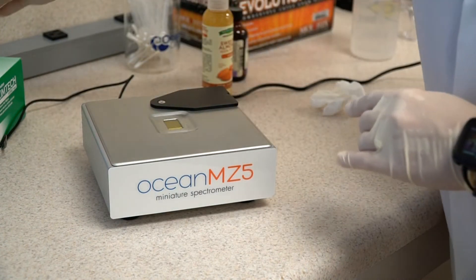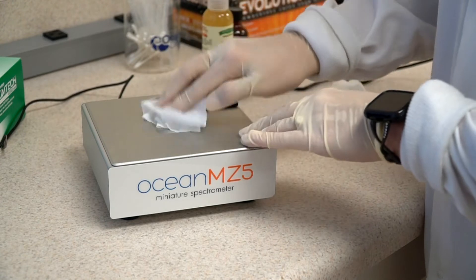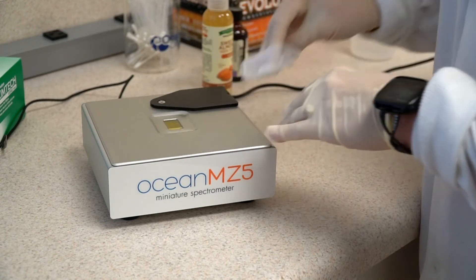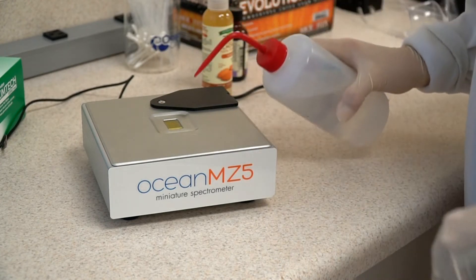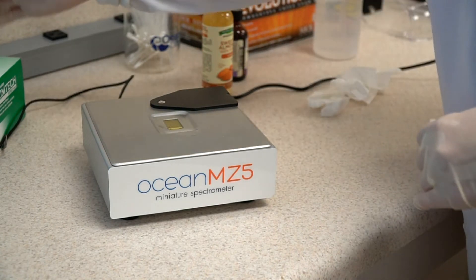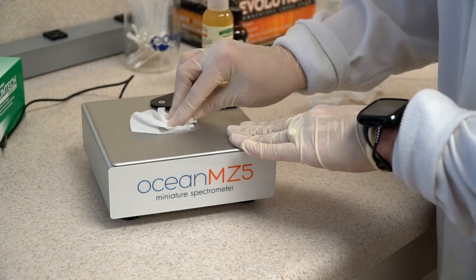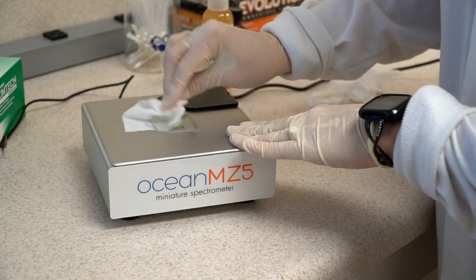Start by blowing off any particulates using a current of warm, dry air like dry nitrogen, and then wipe the crystal with isopropanol or methanol. Make sure you're using a soft, non-abrasive, lint-free cloth to avoid scratching the crystal.